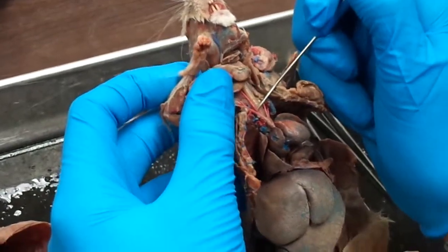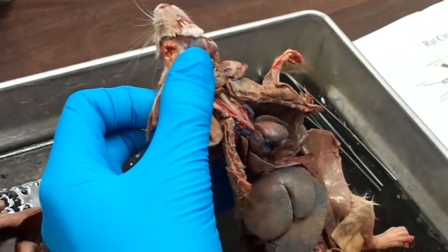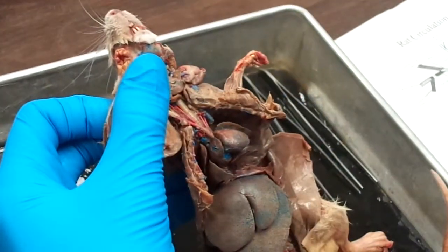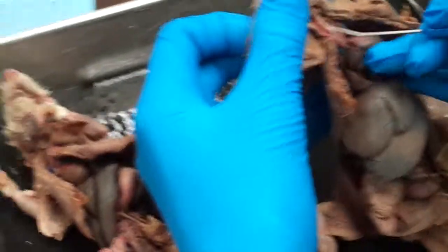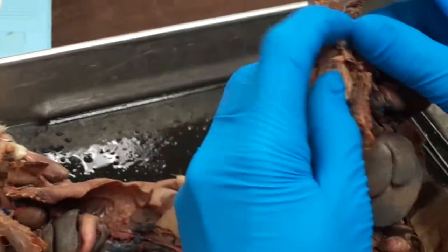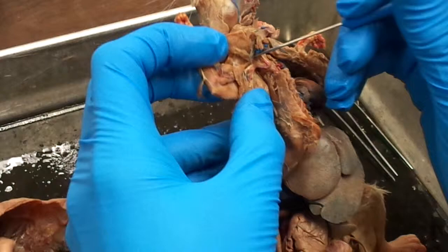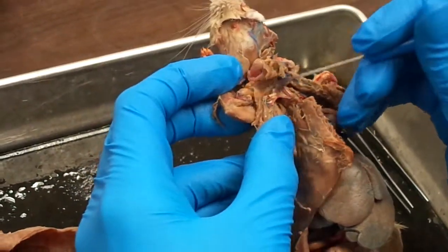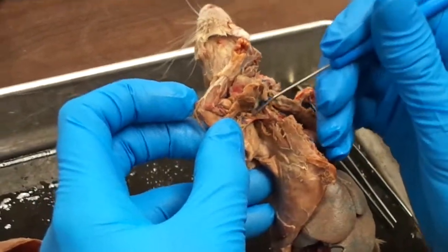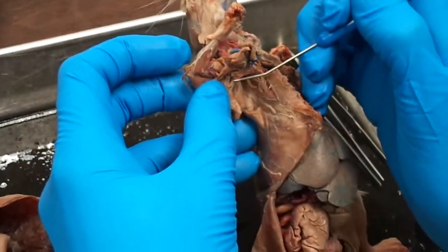So you follow your subclavian up, you'll see this next split, which one of them is going to be your superficial cervical artery. That'll be this one. And your third branch artery is your axillary artery, which is right here. The axillary is going to branch into three different things. You're only responsible for two of them. The one that's broken right here, you can see it's headed to the arm. That's your brachial artery. And the one coming into the body wall is your lateral thoracic artery.